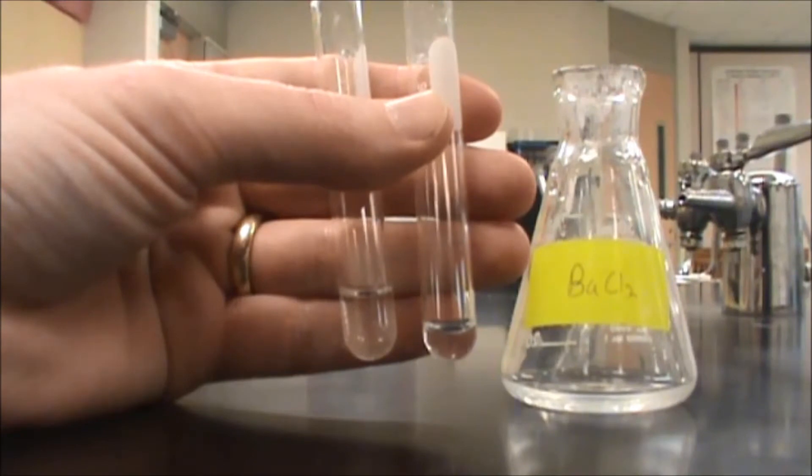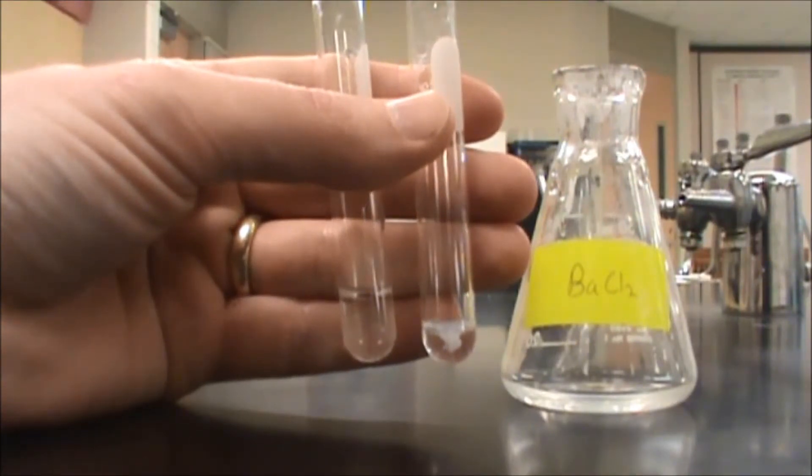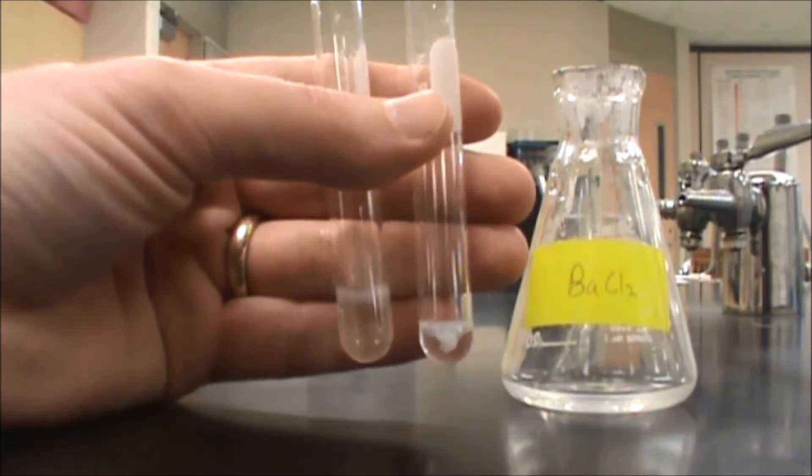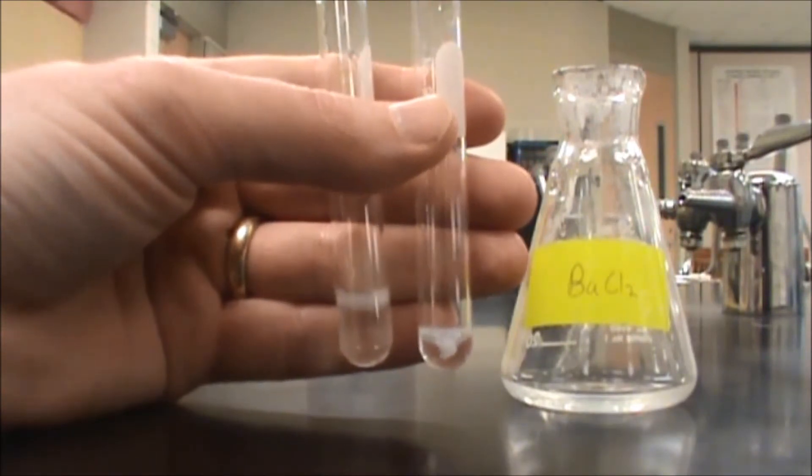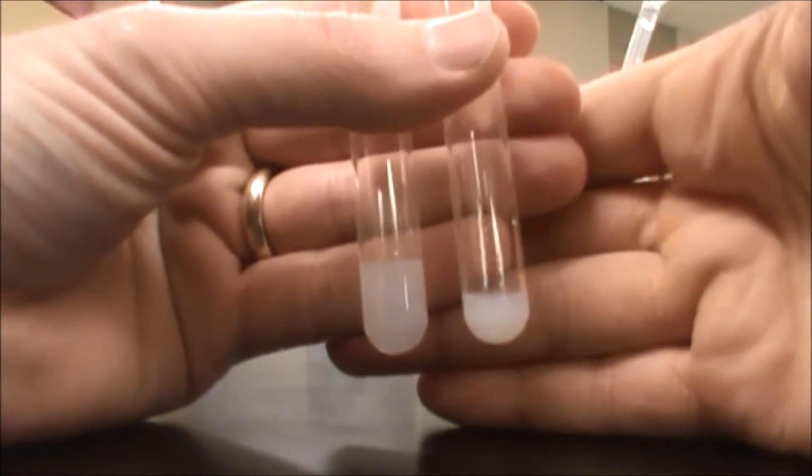I'm just going to put a drop of this in there. When I do you can see that precipitate forming, and then likewise in the sulfate I've also formed a precipitate. So I'm going to mix those up so that we can see, definitely having a precipitate in both.